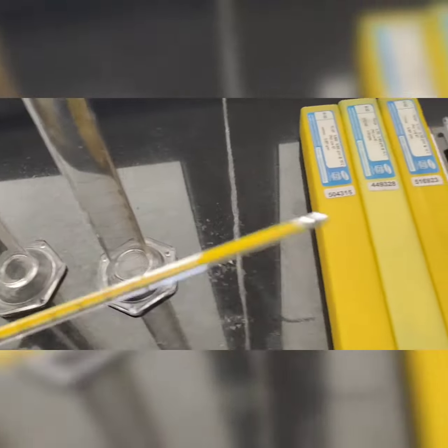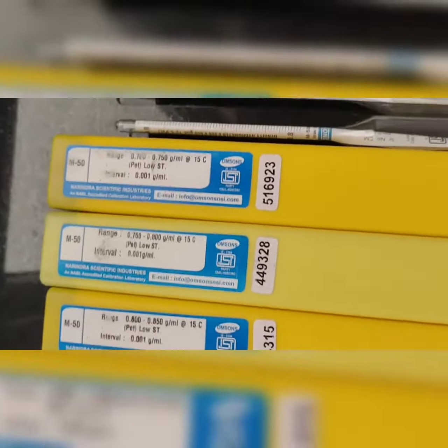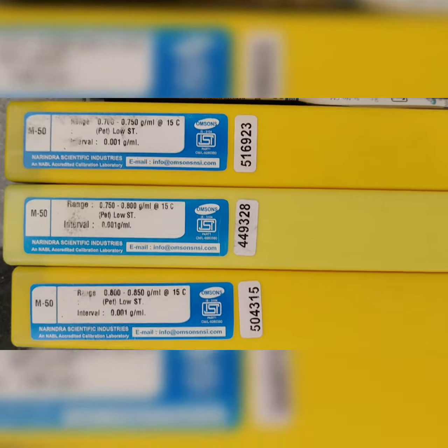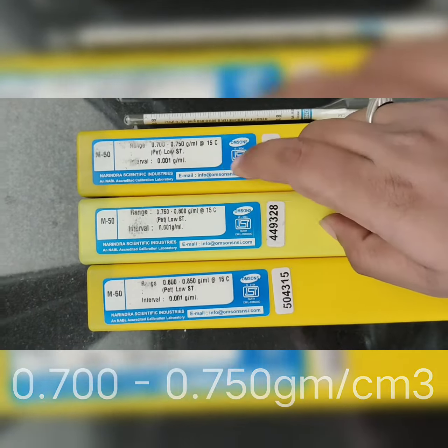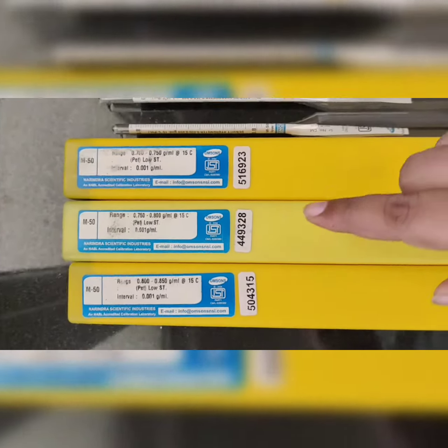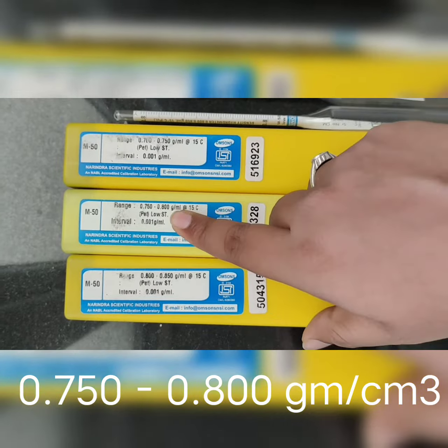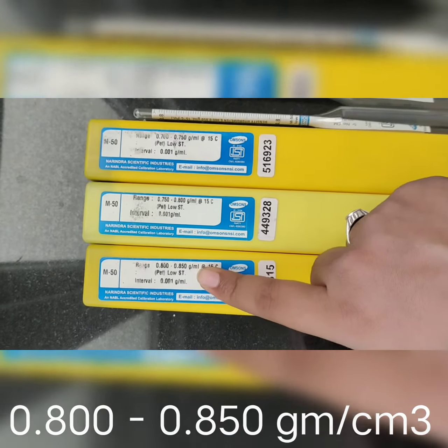Okay. Then we are having the hydrometers. So we can check the hydrometers here. We are having 3 types of hydrometers. First one is 700 to 750. This hydrometer will be used for petroleum analysis. And 750 to 800, this one will be used for diesel and kerosene. 800 to 850, this one will be used for diesel.